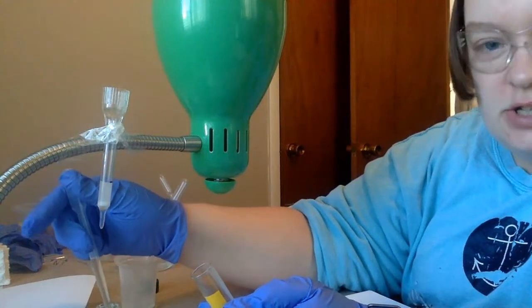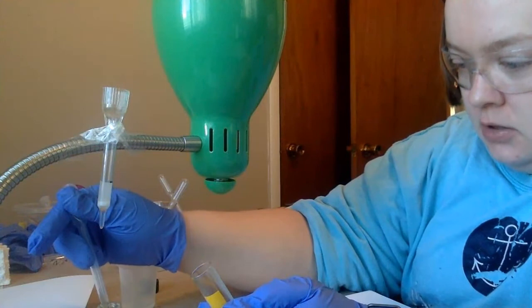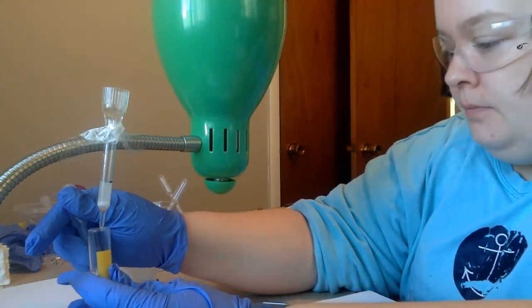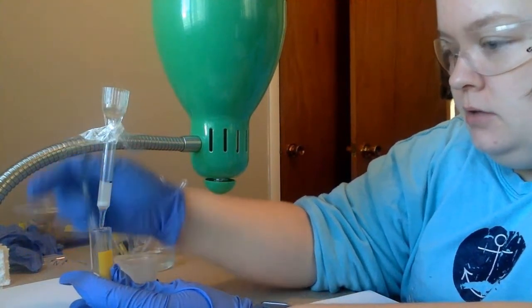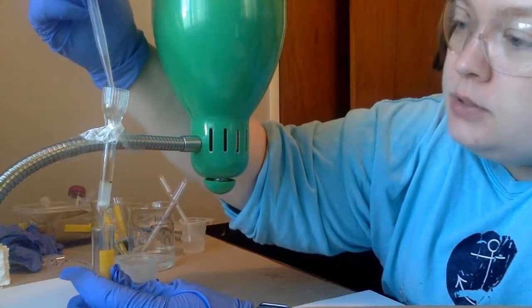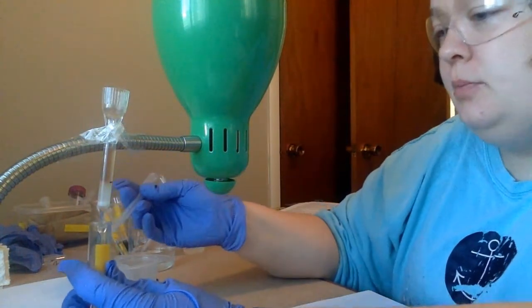And the reason I'm doing that is so that in case something happens and I mess up, I still have some left, because we got plenty here to work with. Alright. And if it separates, great, then I can add the rest of it. But I'm going to just start with this here. I'm going to let it separate.